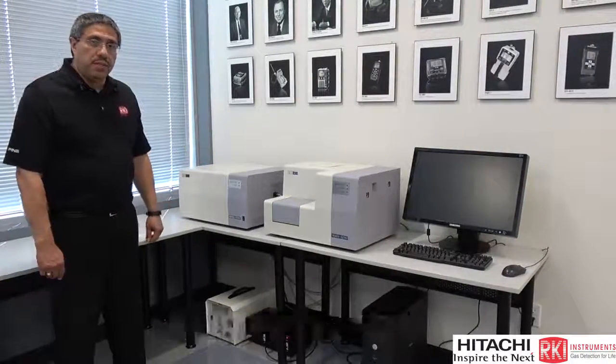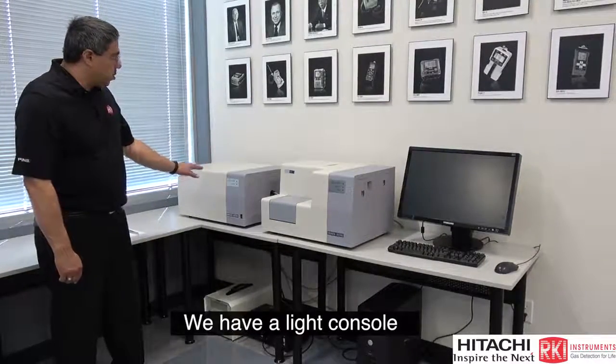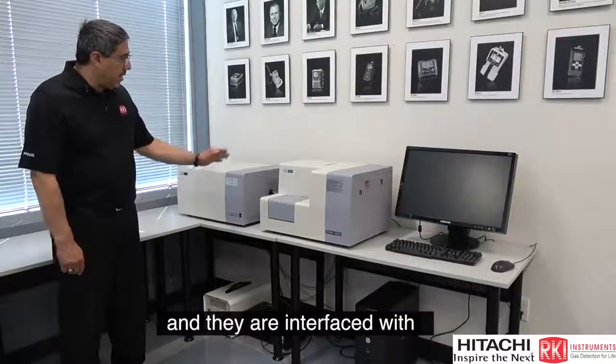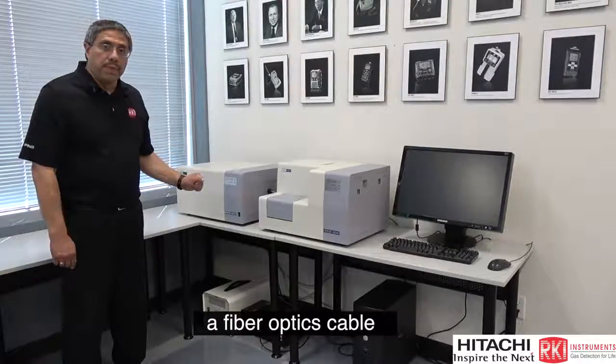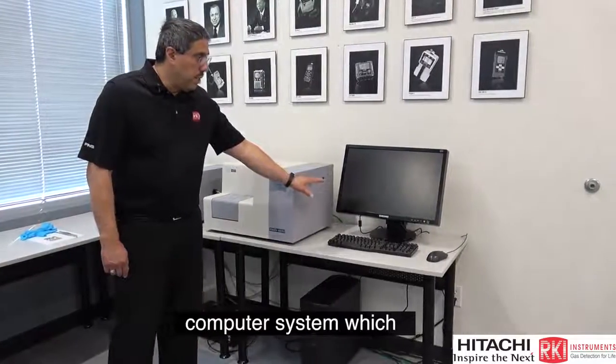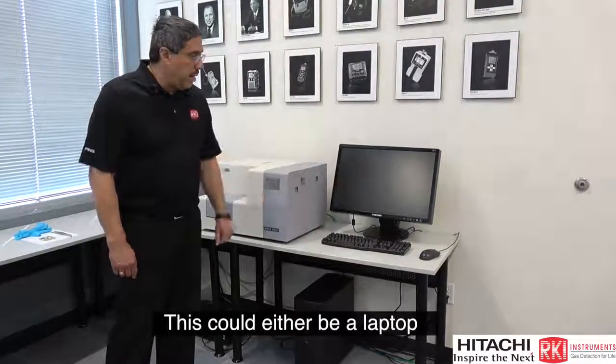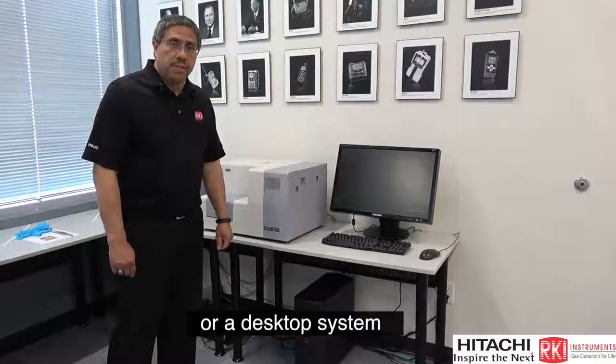Basically, the AC2 system consists of two modules. We have a light console and a detector console, and they are interfaced with a fiber optics cable. To the right, we have a computer system which basically houses the computer program. This can be either a laptop or desktop system.